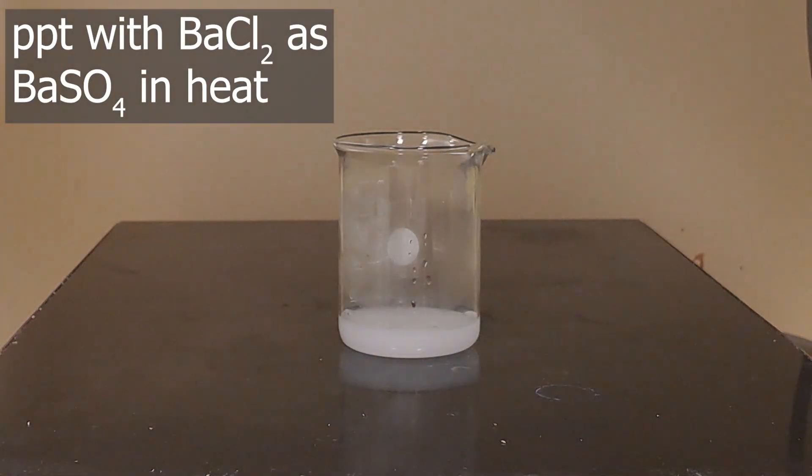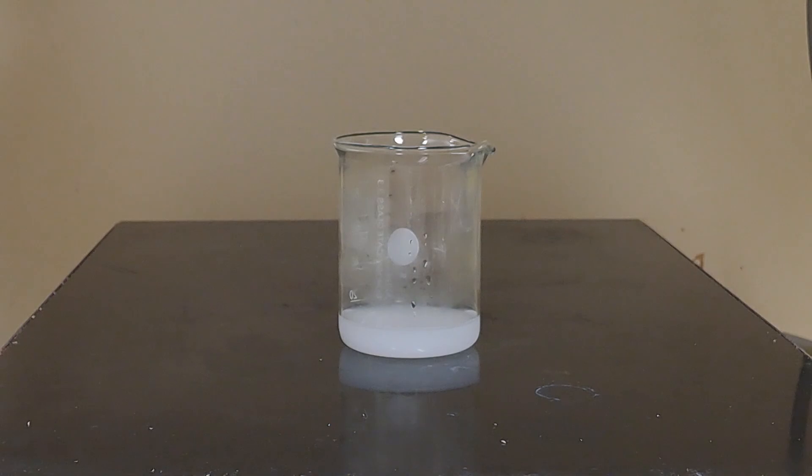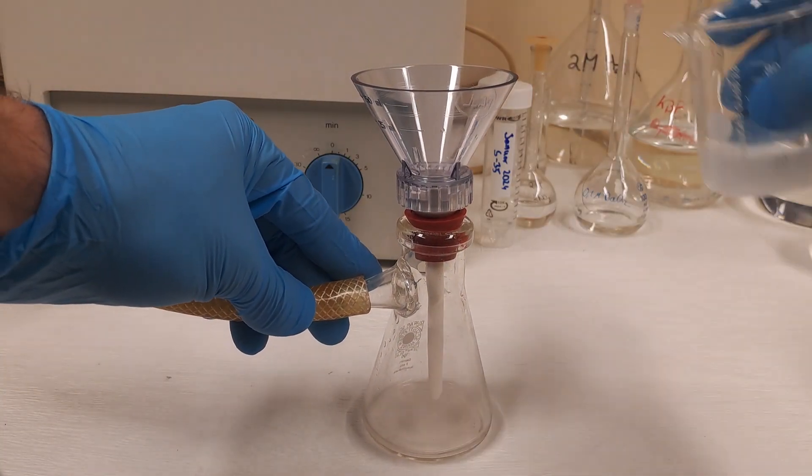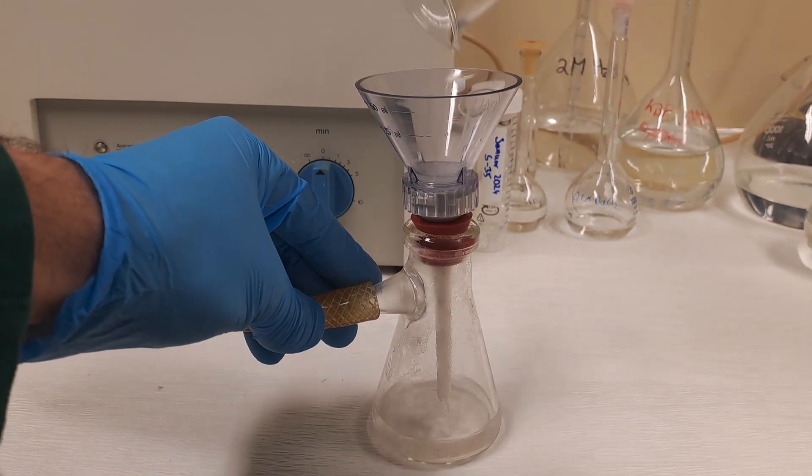Don't be too cautious. We want large barium sulfate clumps. Take your time, the barium sulfate needs to precipitate in warm solution.